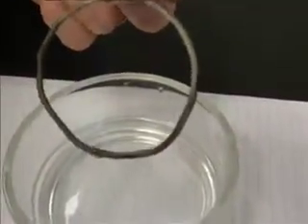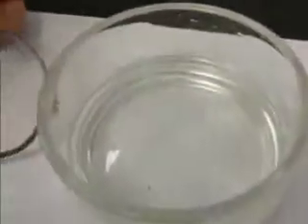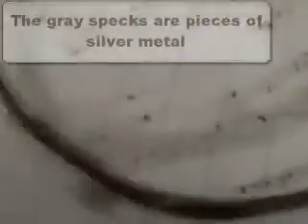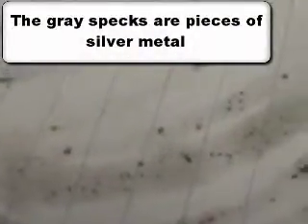That's pretty cool. Mr. Sams, why don't you put that on that little piece of paper maybe, and I bet it'll flake off. Kind of tap it. Some of our silver metal there on the paper. Chunks of silver. So if we were to collect that silver, Mr. Sams, we could make a ring out of it.